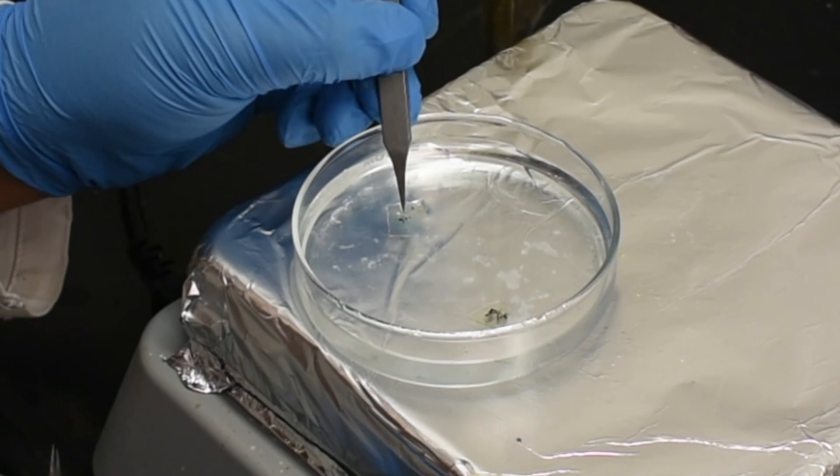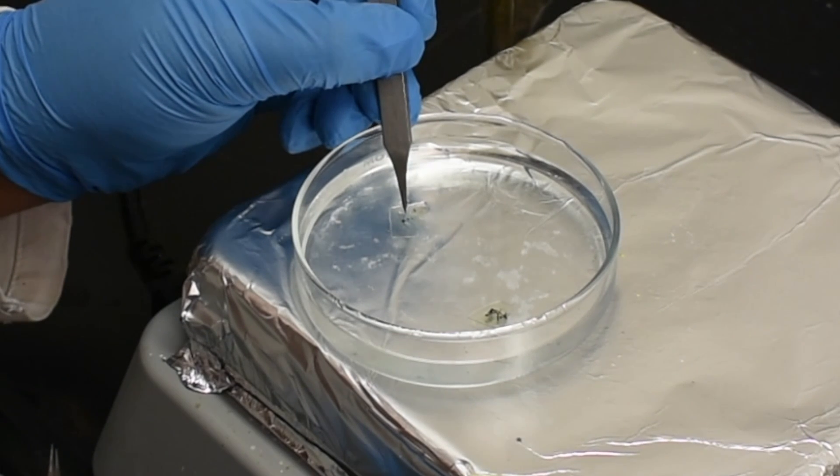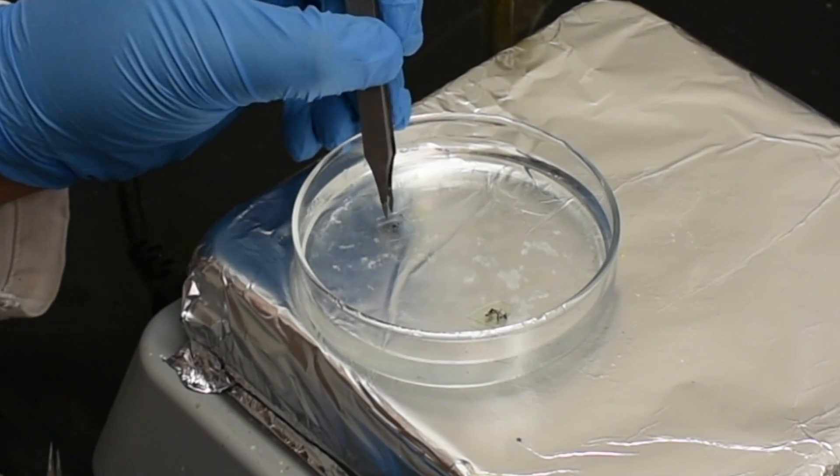Care must be taken to not flip over the film. If flipped, the film will be damaged and develop an easily observed wrinkled texture.